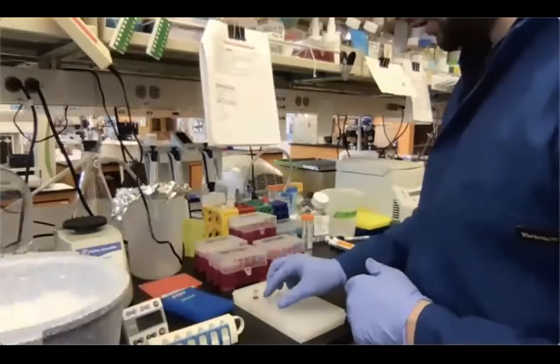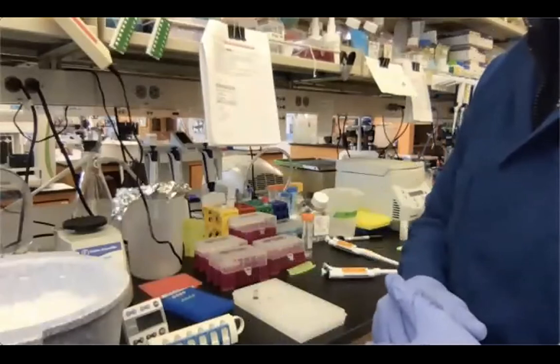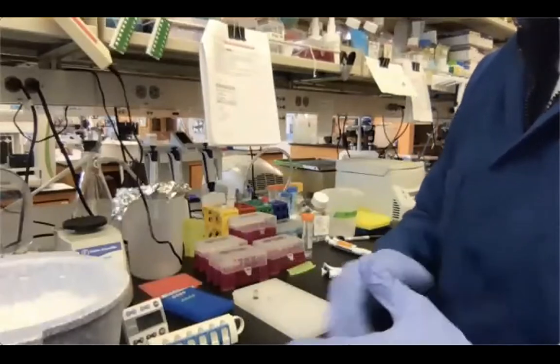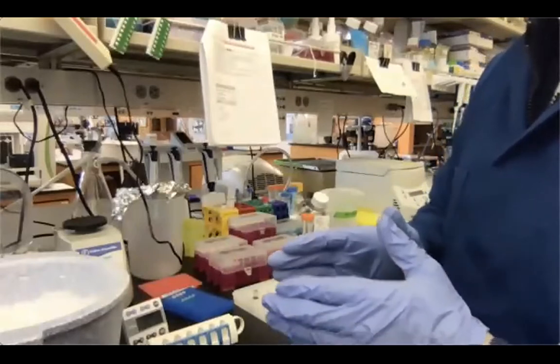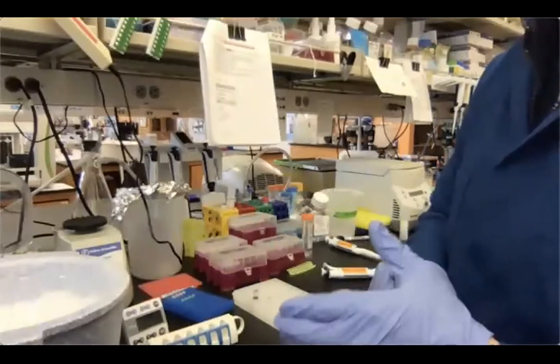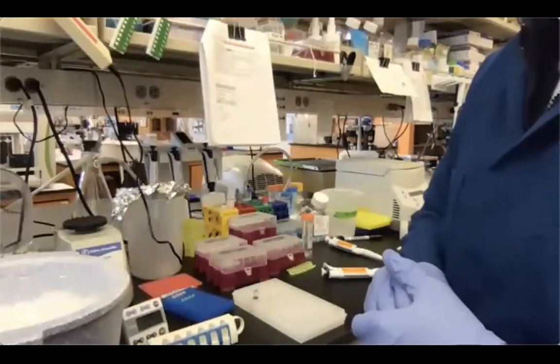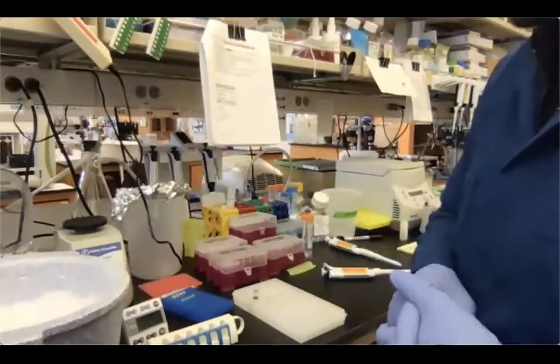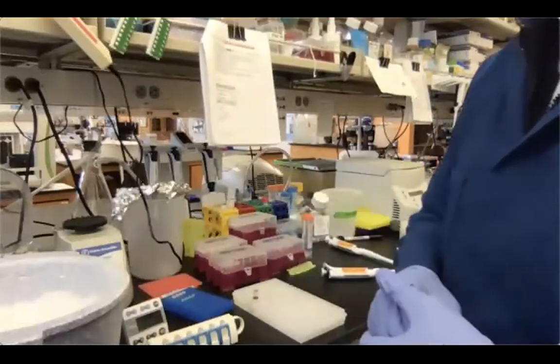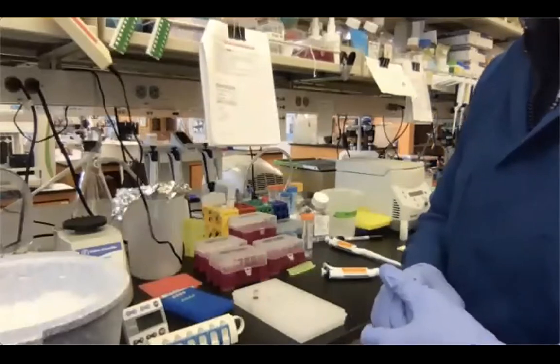Now, the two purifications are going to be different, as well as the previous step, the adapter ligation. If you remember, the previous step that we just finished had sample number 1 with the standard library preparation requirements, which were 2.5 microliters of 15 micromolar adapters, while sample number 2, or sample B, used 10 microliters of 15 micromolar adapters.